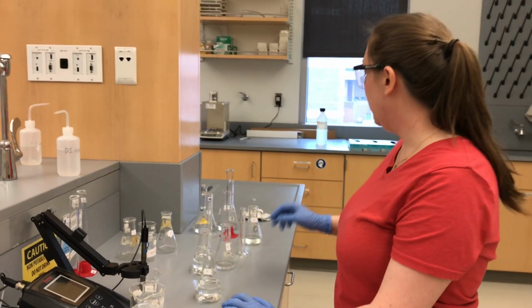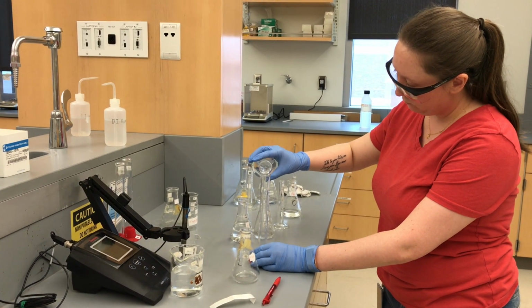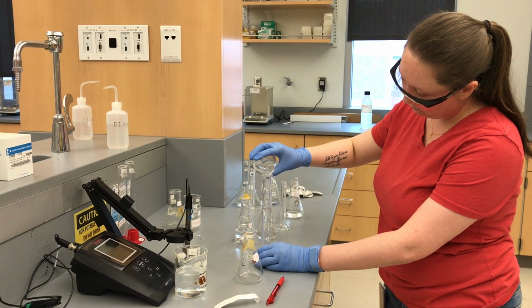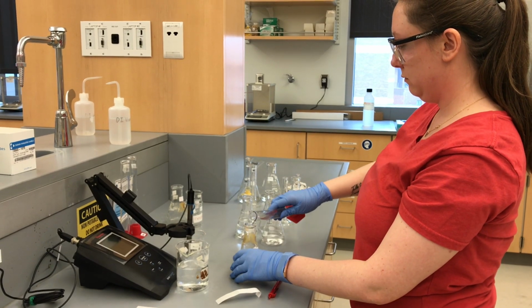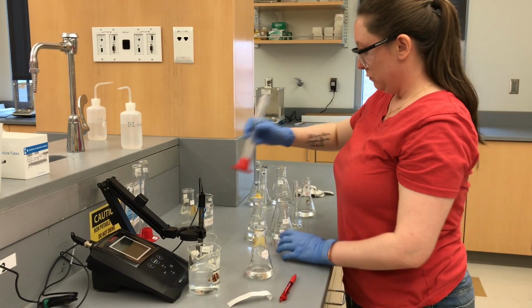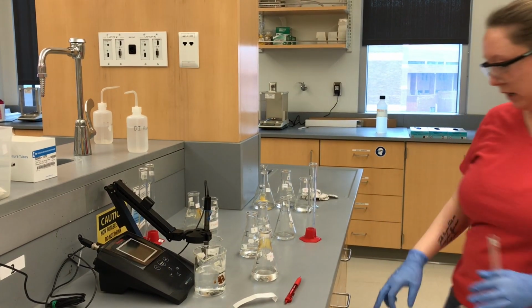All right, so we need 40 mils of F. Of HCl.